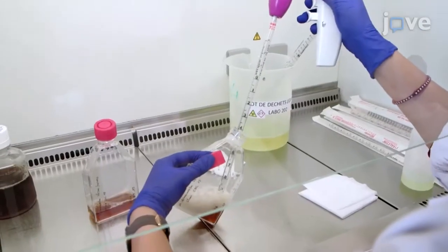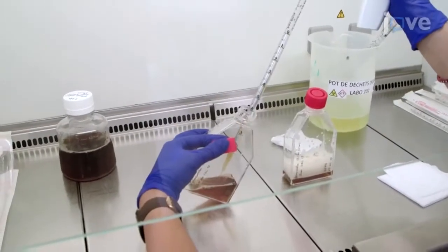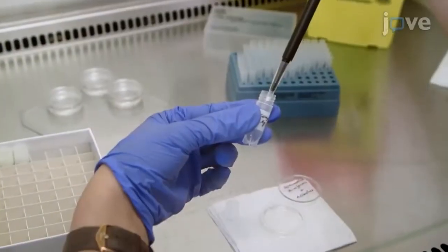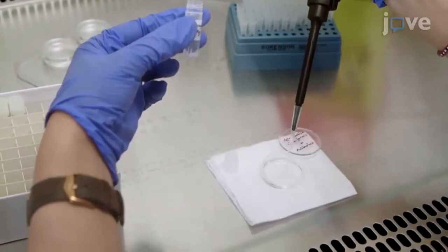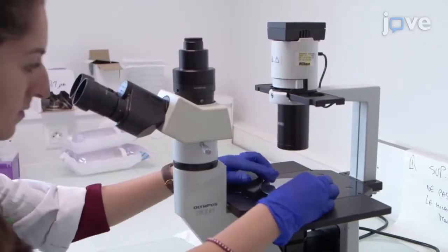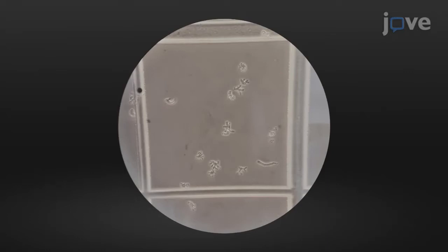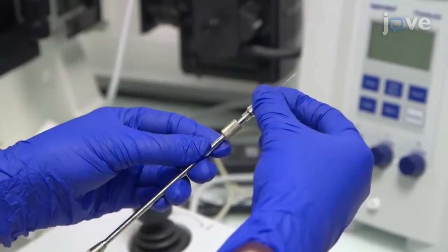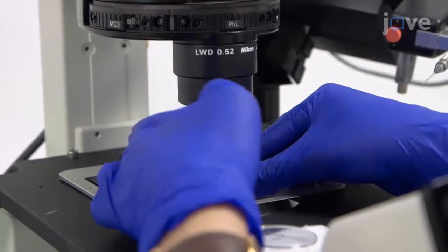The main advantage of this approach is the use of an indirect strategy. It consists of separating and cloning the infected hosts to obtain a viral separation. So, this method monitors the different steps from capture to the release of cells and confirms the sorting process by microscopic observation. Finally, molecular biology is used to confirm the sorting and electronic microscopy to observe the separated viral particles.